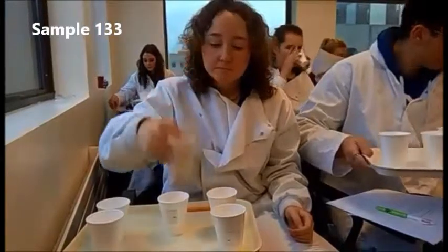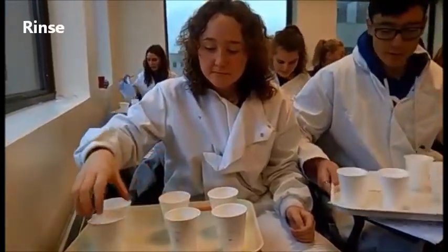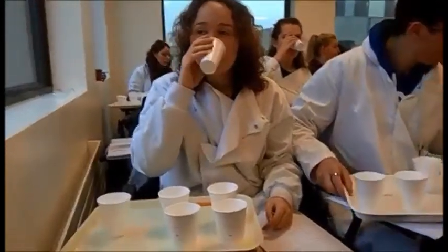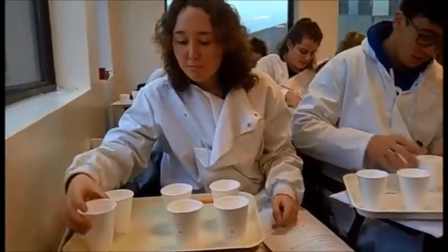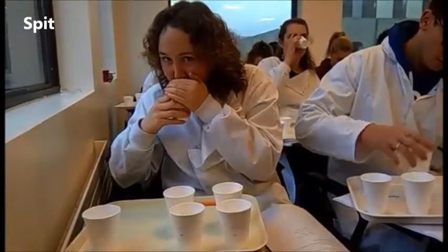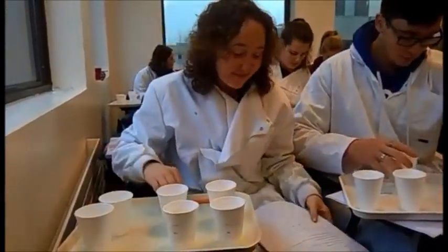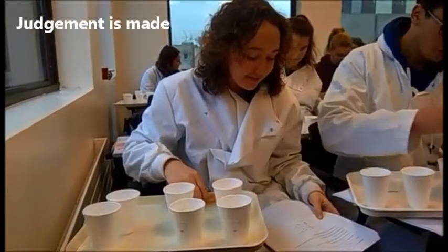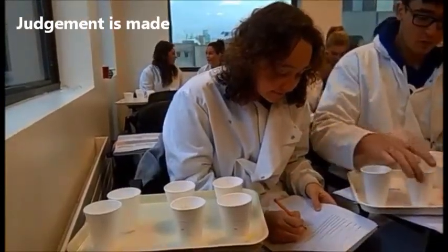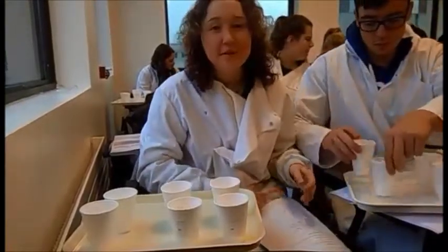Sample 133. She tastes the sample. She rinses with water and she spits the sample back into the cup. She now makes her judgment and rates the sweeter cup with a 1 and the less sweet sample with a 2.